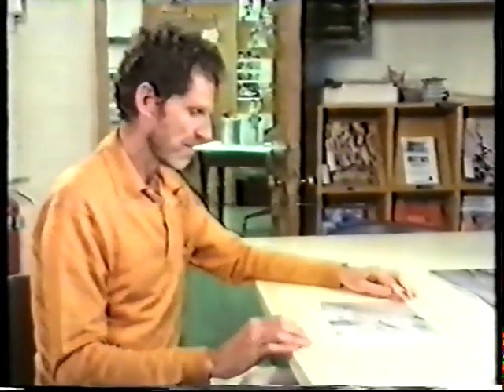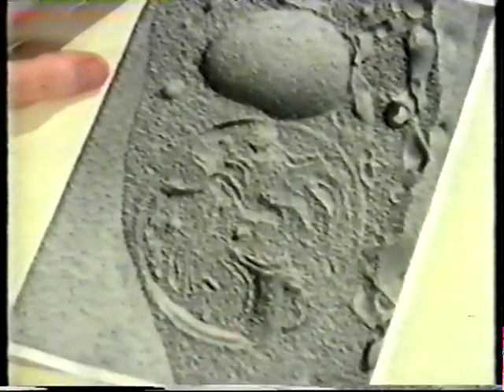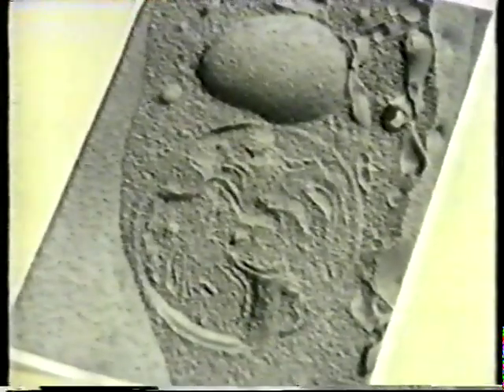What do we see by freeze etching? For example, in this electron micrograph of a freeze etched replica, we can see the nucleus with its pores, and out in the cytoplasm, endoplasmic reticulum. In this micrograph, at higher magnification, we can see a mitochondrion which has been cross-fractured, and inside the mitochondrion we can see cristae with some of the fracture faces exposed.